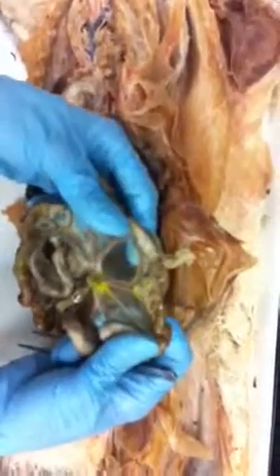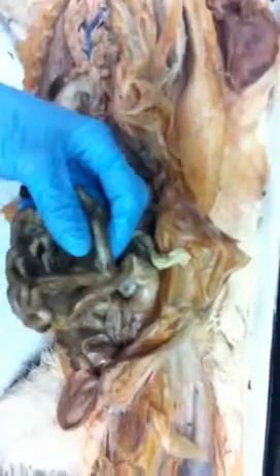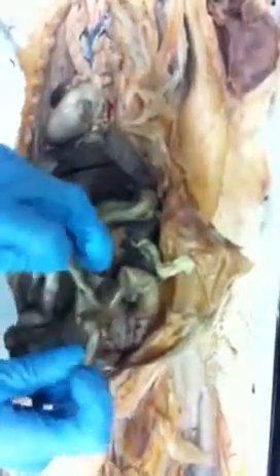Okay? This up here, what you're talking about here, this is the mesentery. Yeah. That's the mesentery right there. And your small intestines isn't just tied up in a knot and stuffed in there. It's actually held in a very specific orientation, and that's what that membrane helps to do. Because you don't want it to be all kinked.